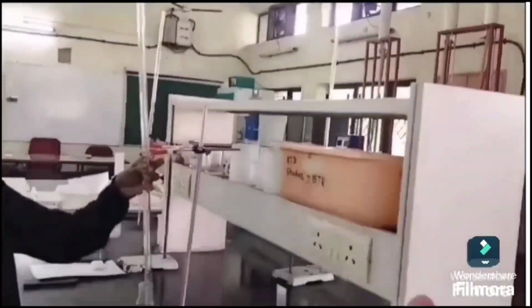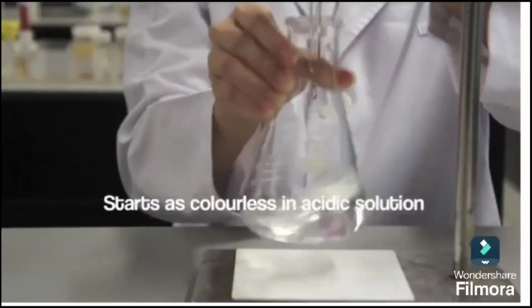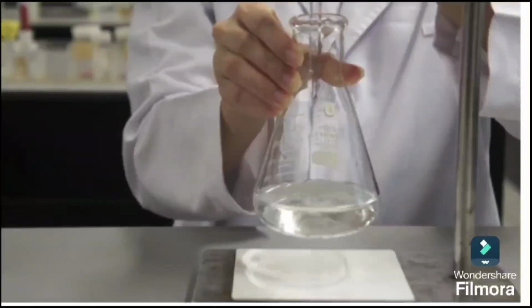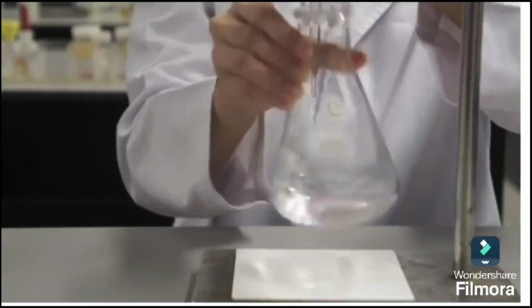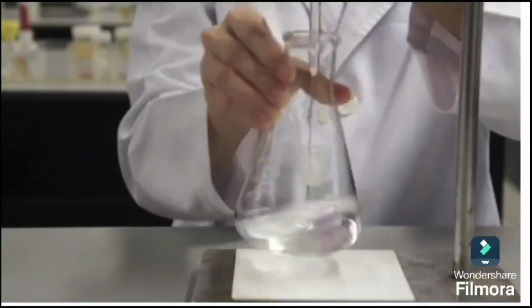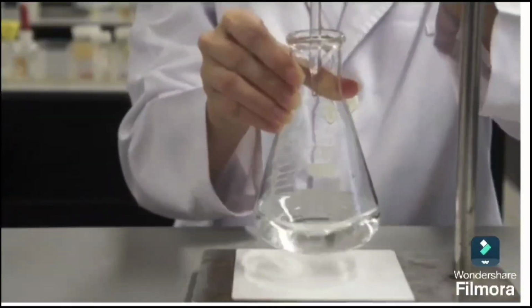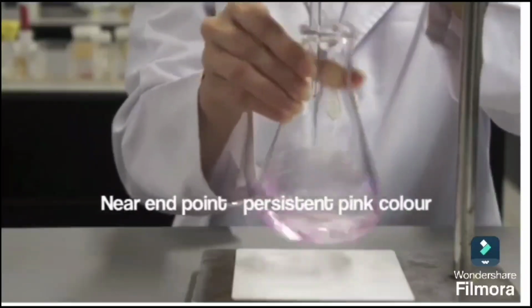Now I am fixing this burette to the burette stand and starting the titration. During the titration, NaOH neutralizes the acid in the sample, increasing the pH. At the equivalence point or slightly beyond, the pH of the solution shifts to the basic side. When the pH crosses the phenolphthalein transition range, around 8.2 to 10, the indicator turns pink, signaling the endpoint of the titration.